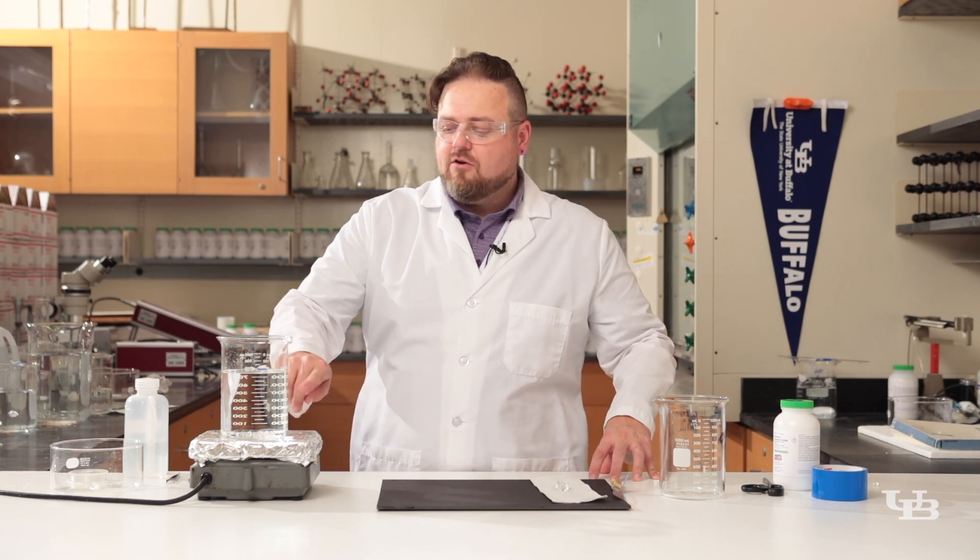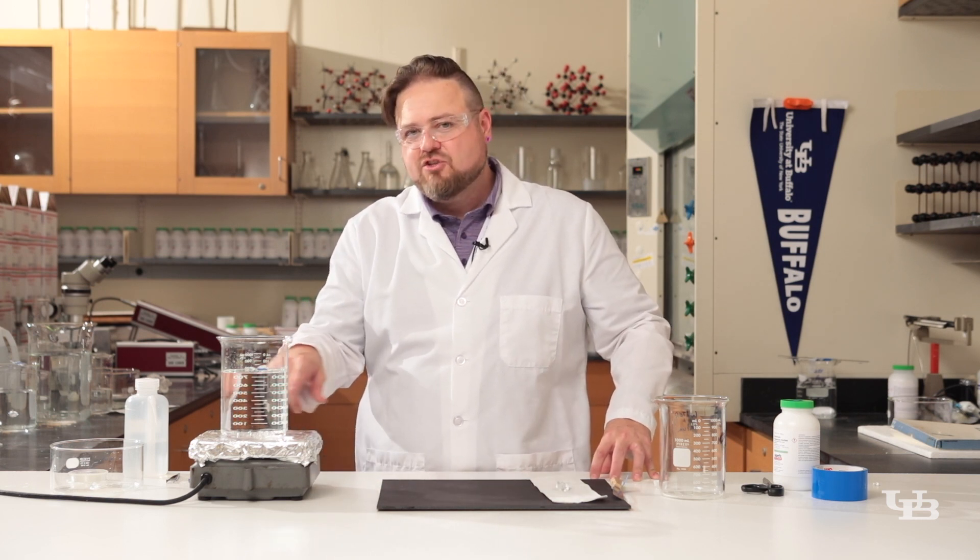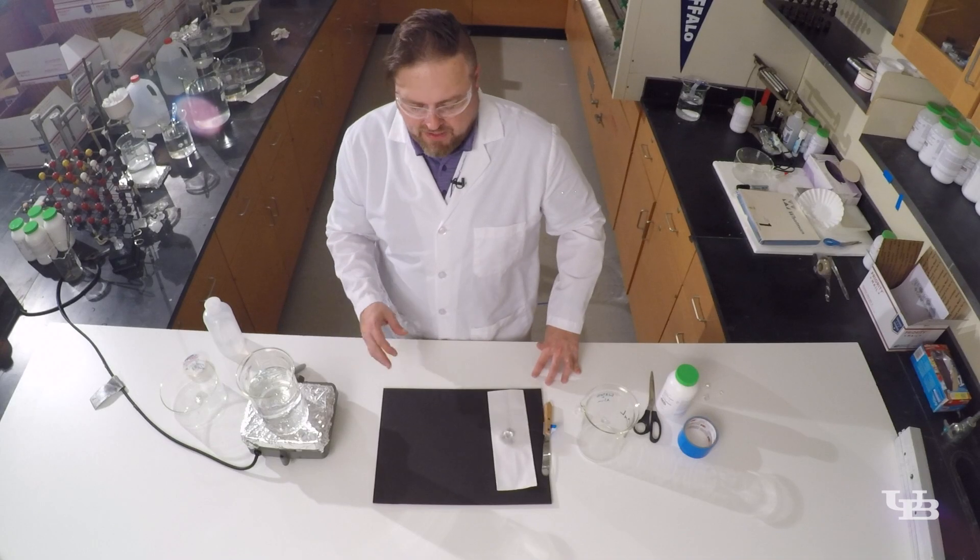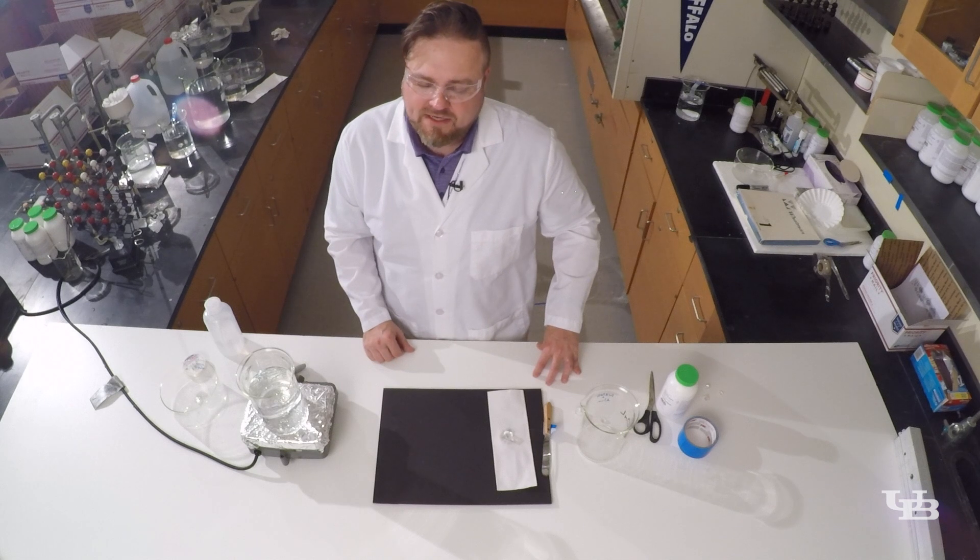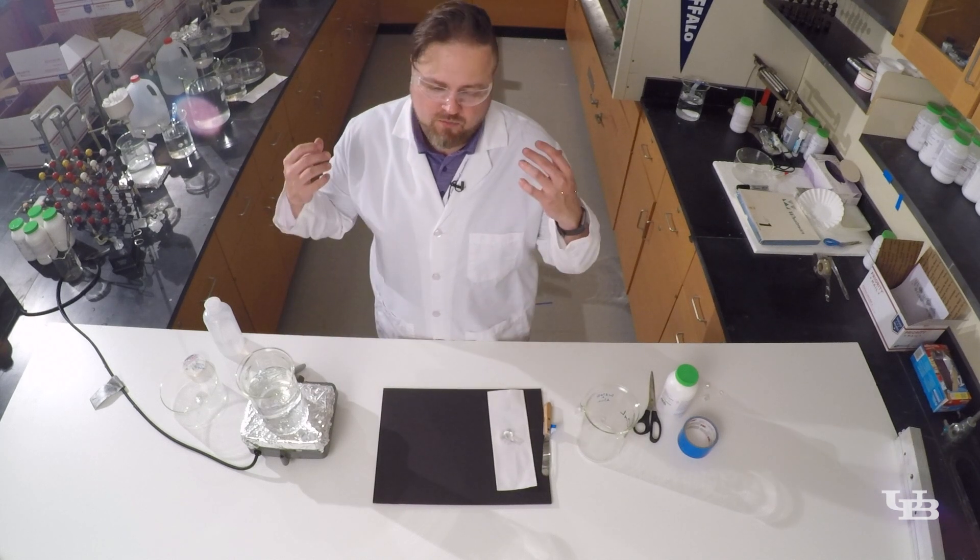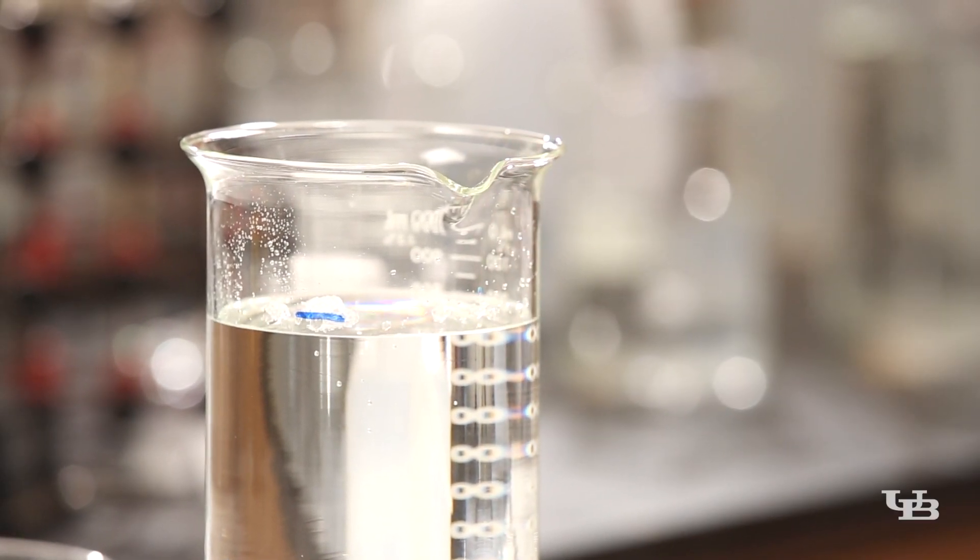The reason you want to add a little bit of water back into this solution is we have a lot of extra alum at the bottom. If we didn't add any more water, when this solution cooled back down all of this alum would want to rapidly come out of solution - it'd be like a snow globe but there would be alum powder everywhere and it could really jeopardize the appearance of our seed crystal.